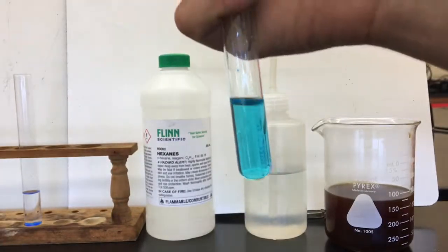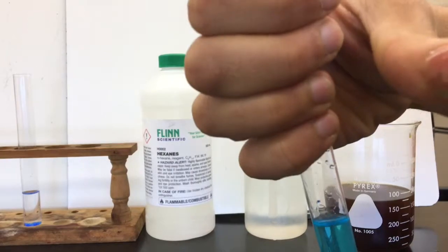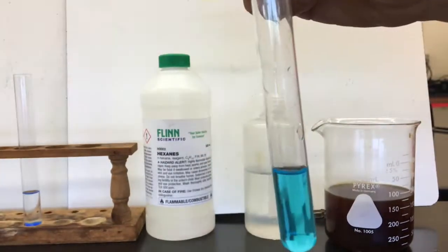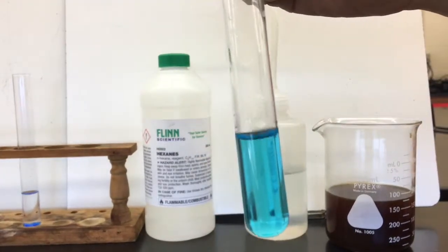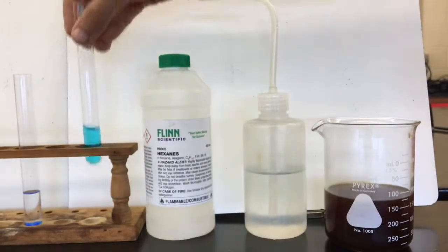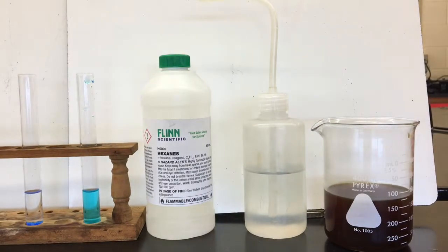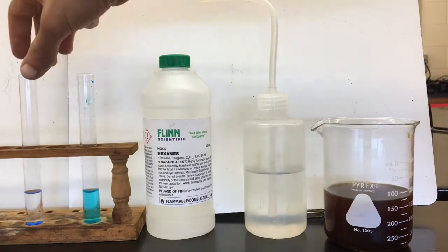It looks like, unless that copper is stuck to my thumb, which it's not, there's a little bit still on the sides, but it looks like it's gone and dissolved. There's a blue color to our solution at this point. That helps indicate to me that our blue solid has dissolved.